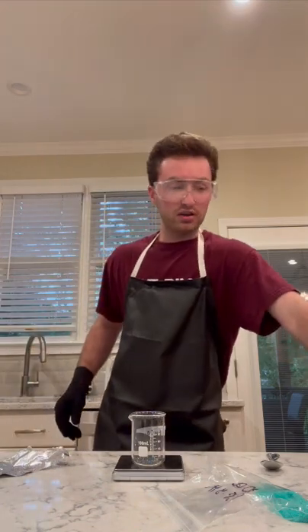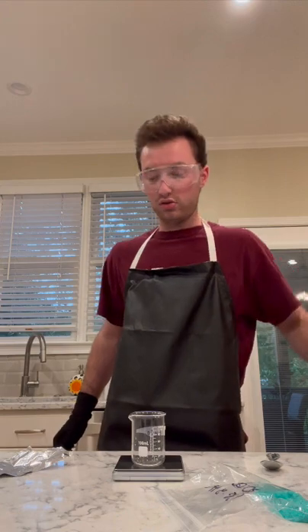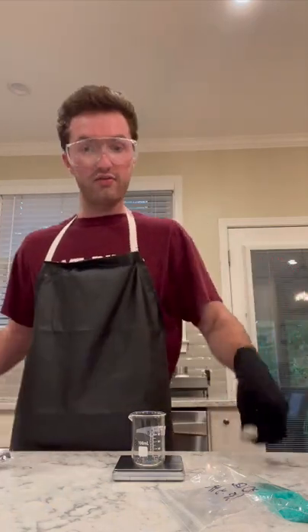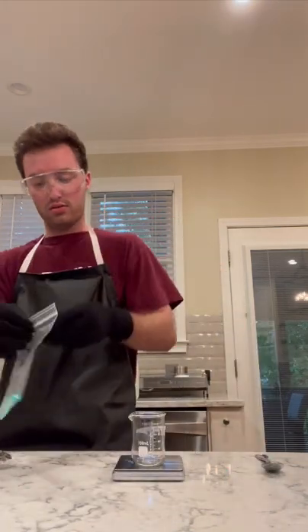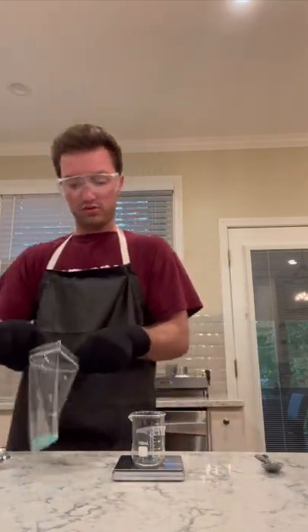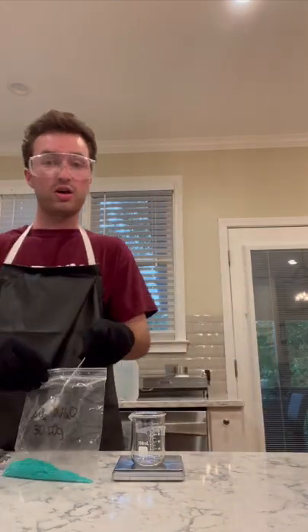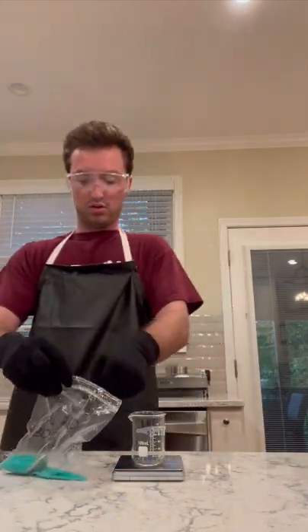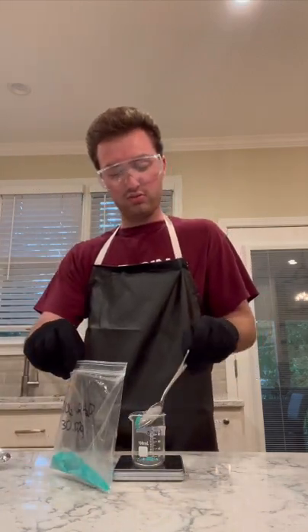I'm going to pour that into my beaker after I get my 3 grams. And just like the last couple of times, I'm going to use my stirring rod to fully dissolve. I have a spoon here to help me scoop out some of my chemical so that I can get an easier transition from the bag to the beaker. I'm not sure why I didn't think about this until now; we could have used this for the first reaction, but now we're using it. So I'm going to measure out 3 grams here.